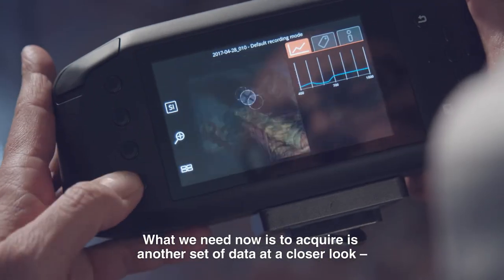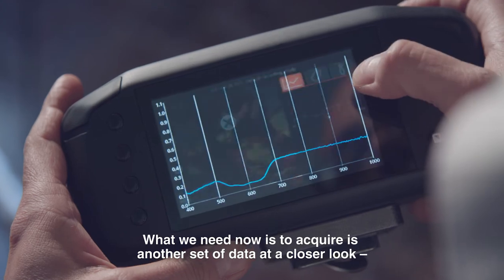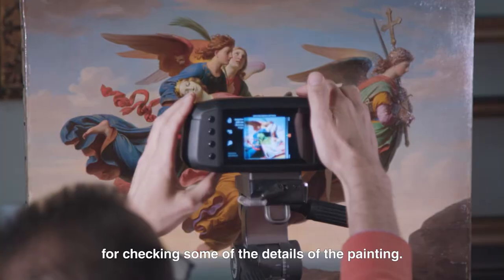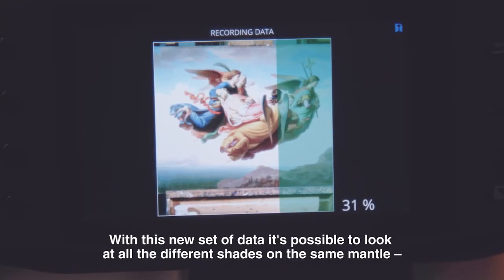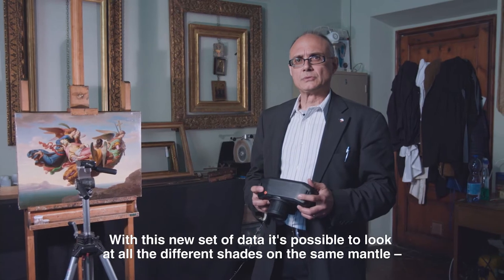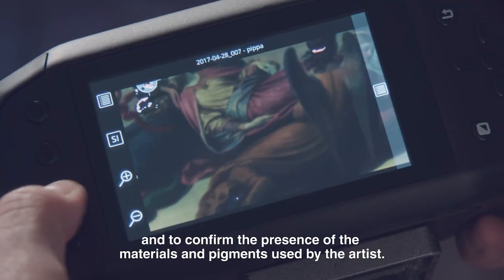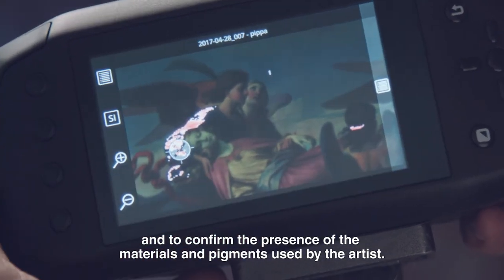What we need now is to acquire another set of data at a closer look for checking some of the details of the painting. With this new set of data it's possible to look at all the different shades of the same mantle and to confirm the presence of the pigment used by the artist.